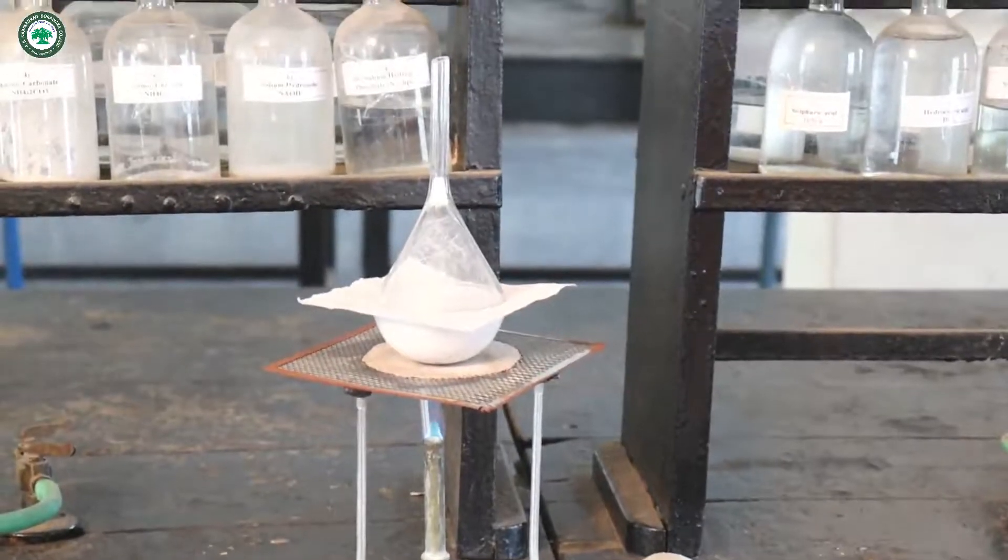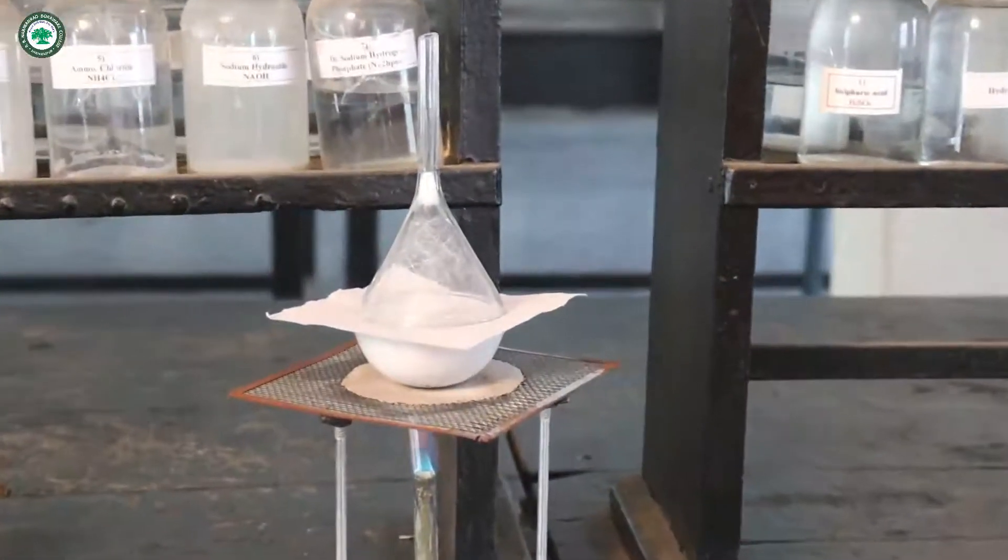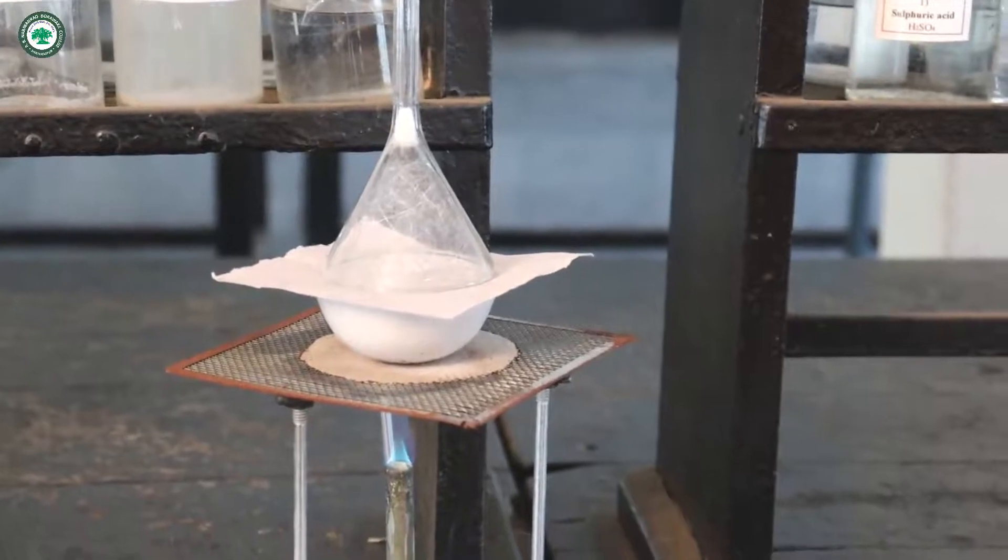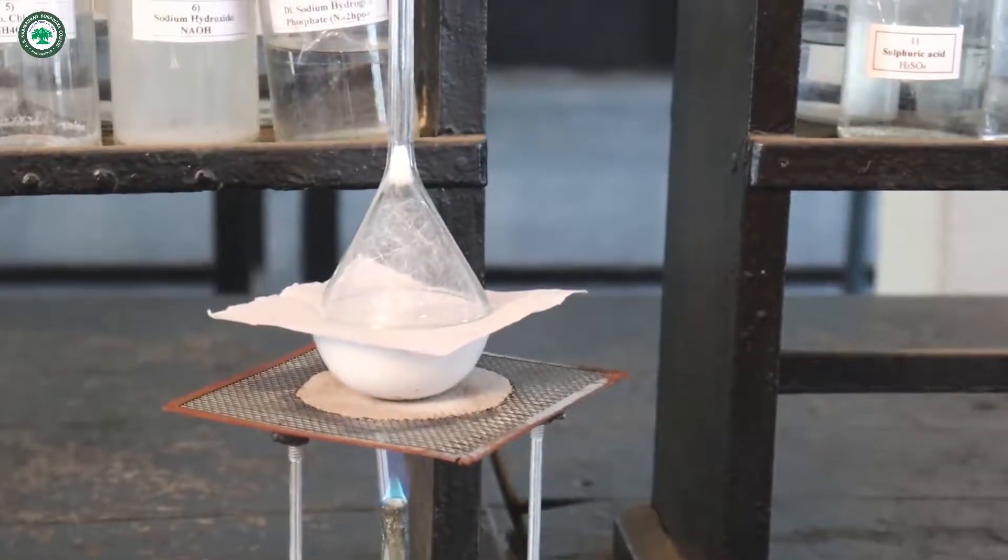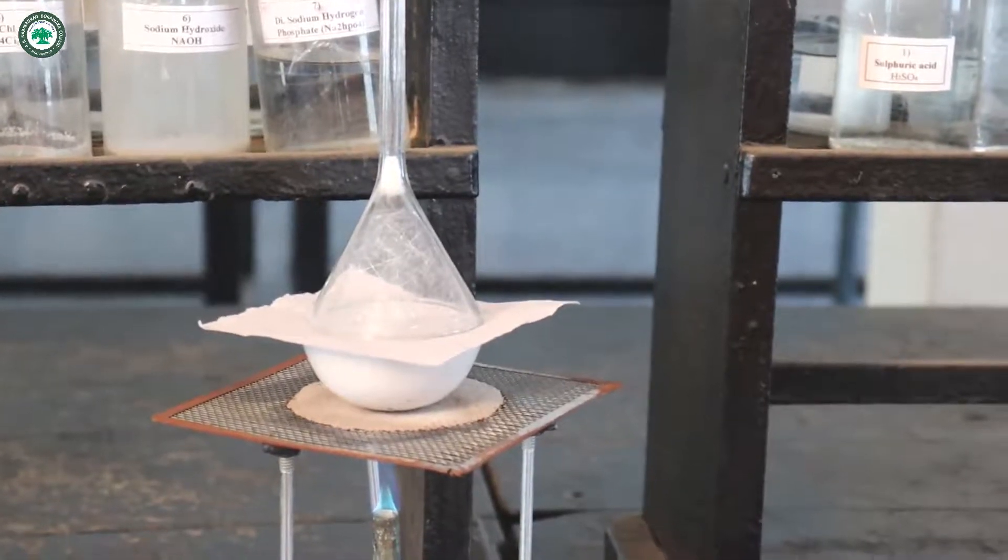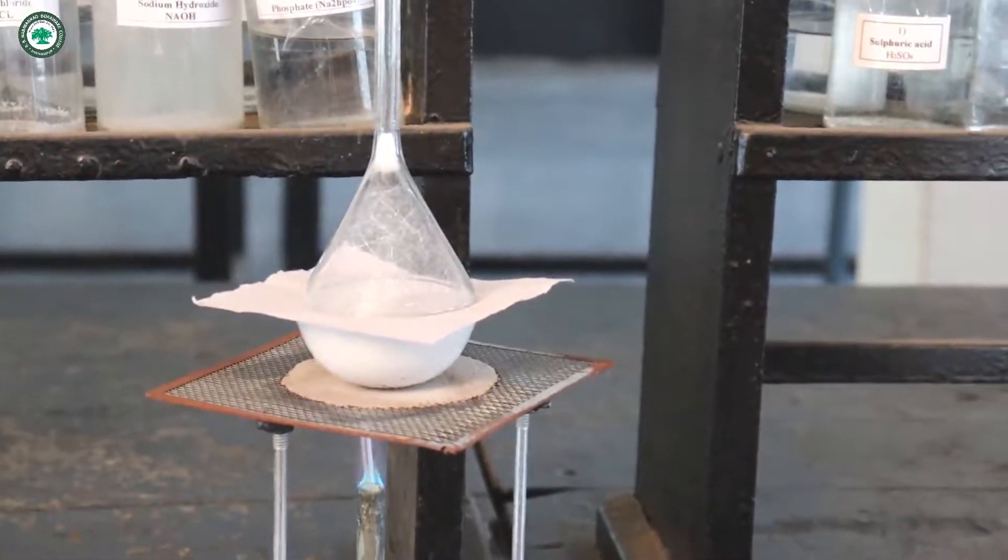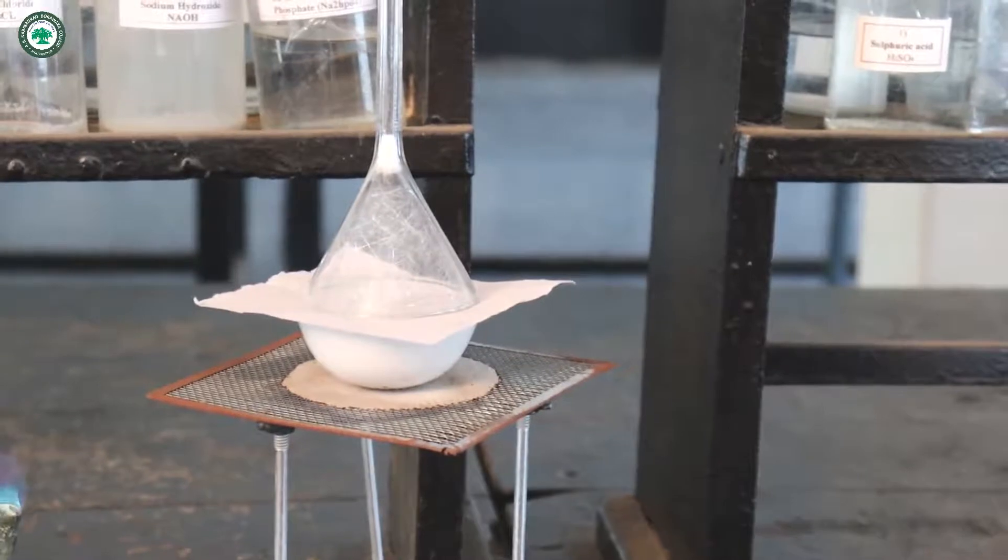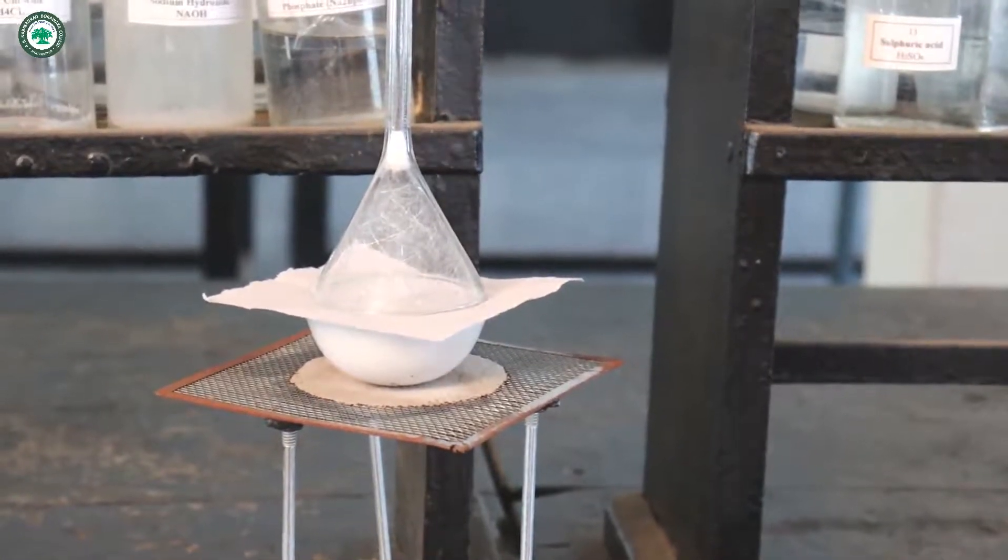Now it is observed that inner side of the funnel containing needle-shaped crystals of phthalic anhydride appears. Then stop heating and wait for the funnel to cool.